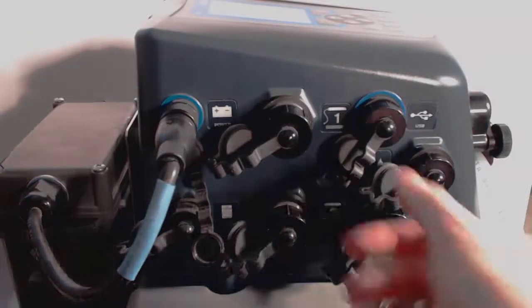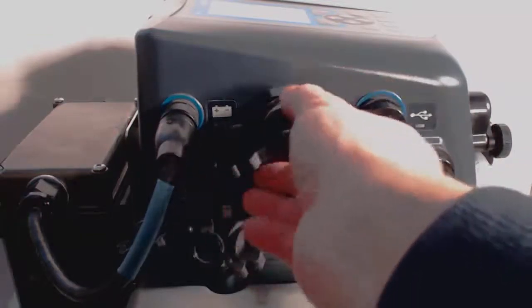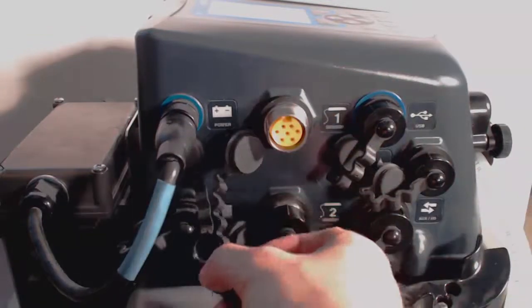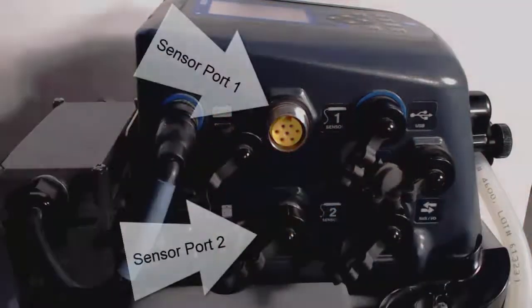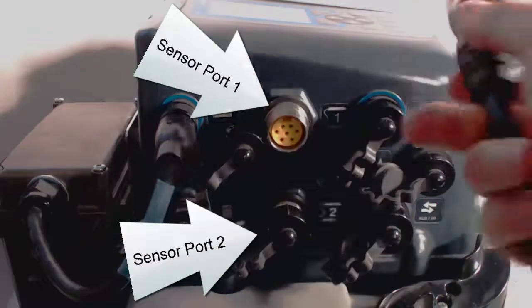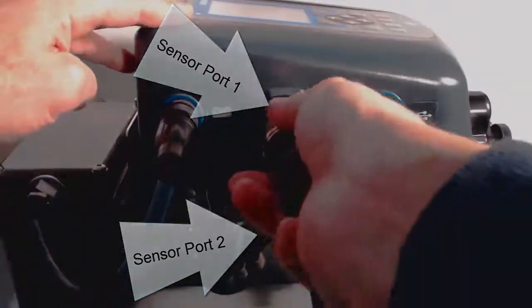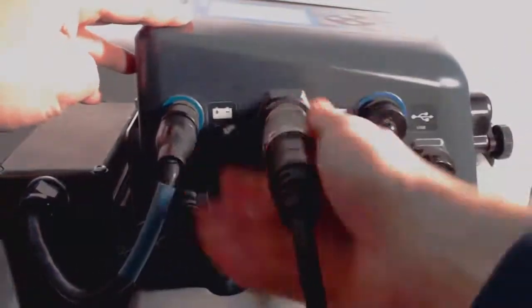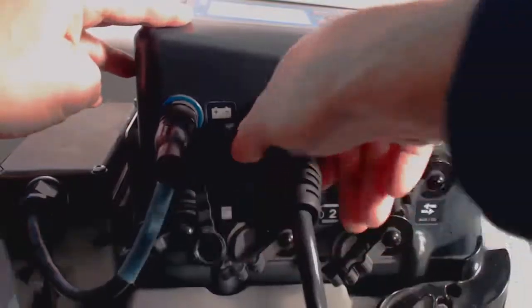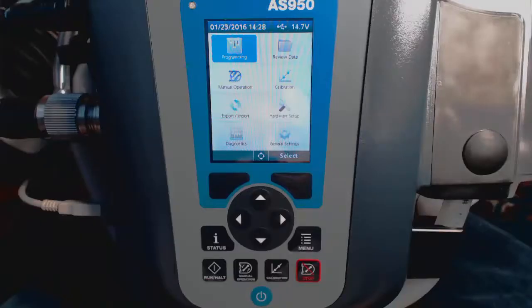The first step is to connect the AV9000 and sensor to the AS950. Next, we'll set up our measurement data logging preferences.